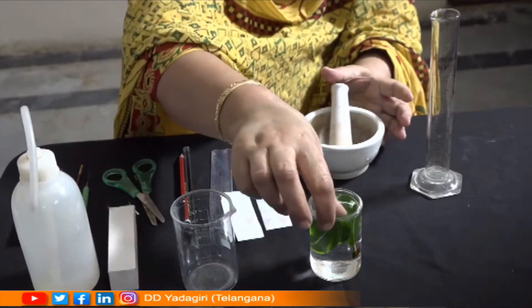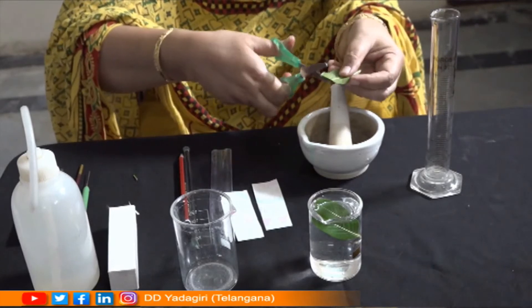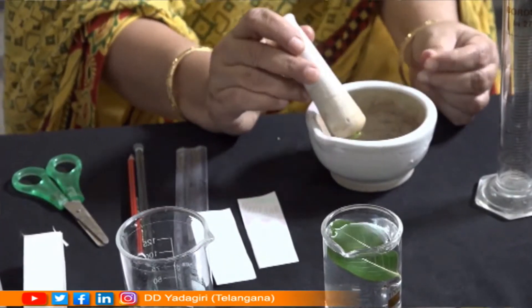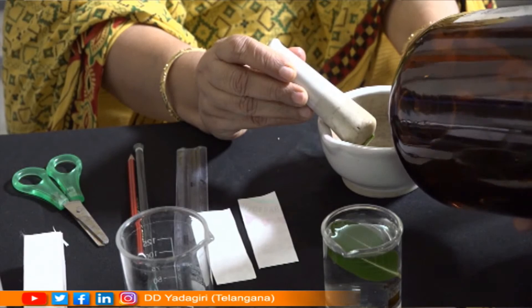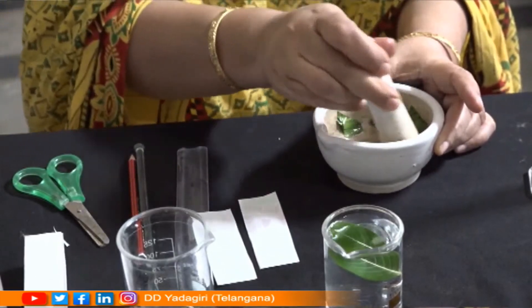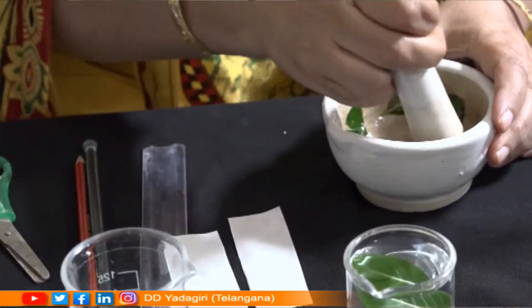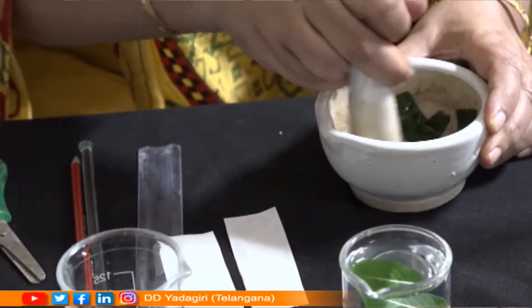First, take the leaves, cut them into small pieces with scissors, and place them in the mortar and pestle. Add a pinch of sand and a few drops of acetone, then grind the leaves into a thin mixture. Once the mixture is ready, strain it into a beaker with the help of muslin cloth so that you get a green mixture devoid of all the leafy solid material.